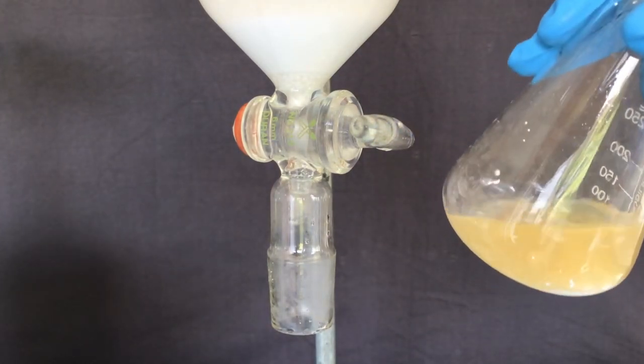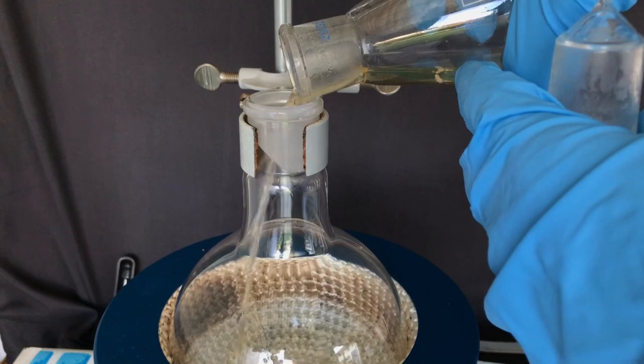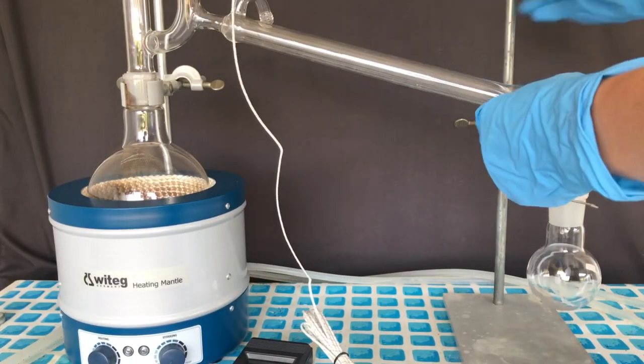Swirl a few times, transfer to a dry flask, set up a distillation setup and you are ready for purification by distillation.